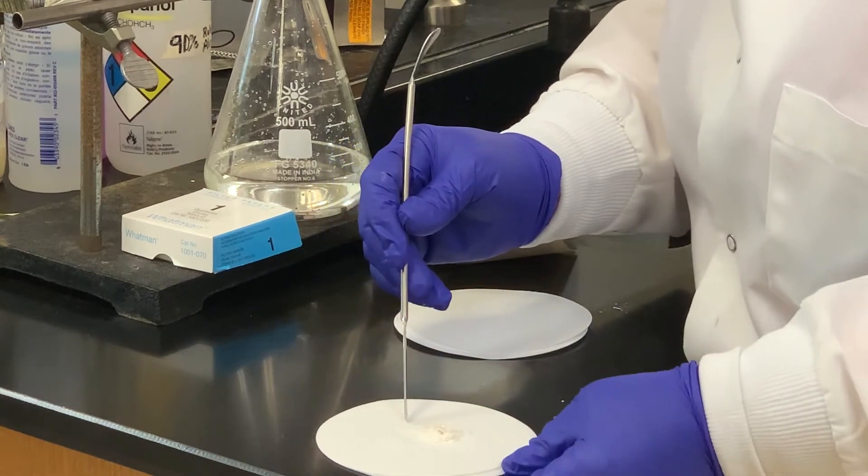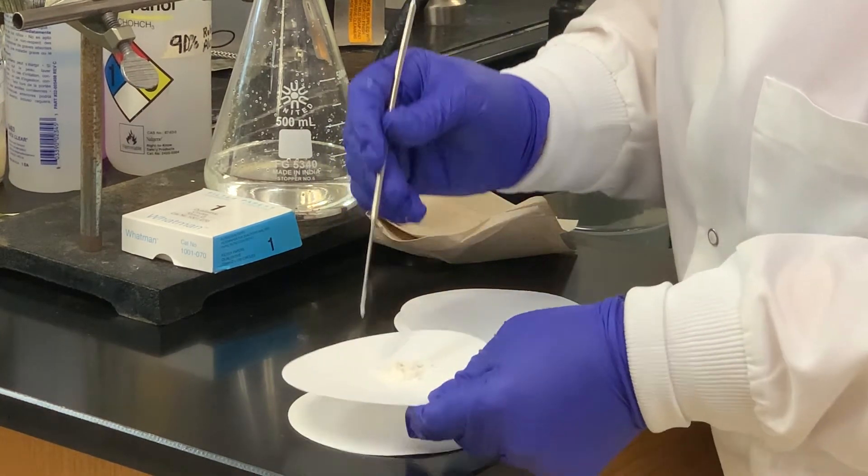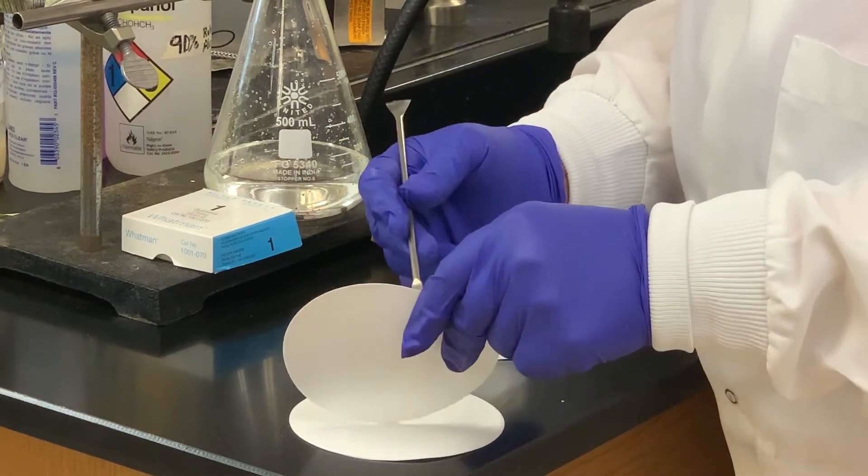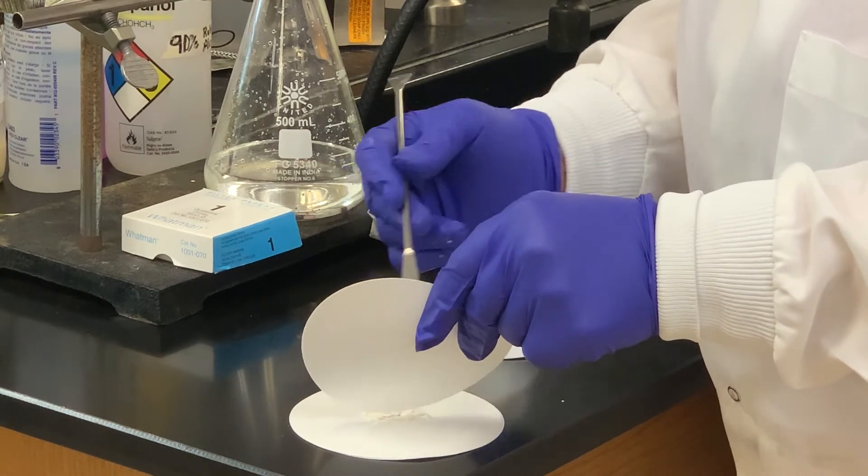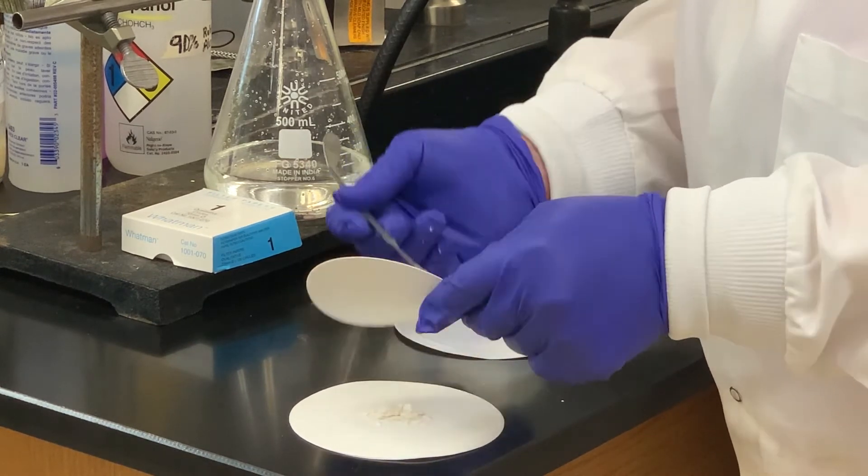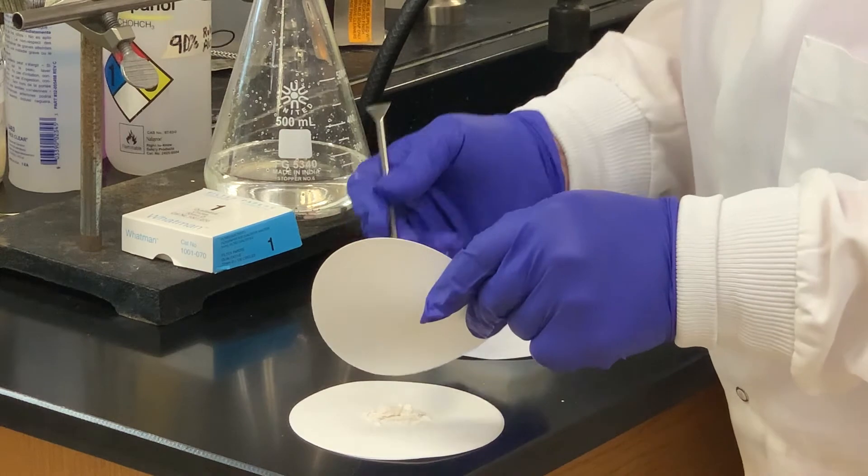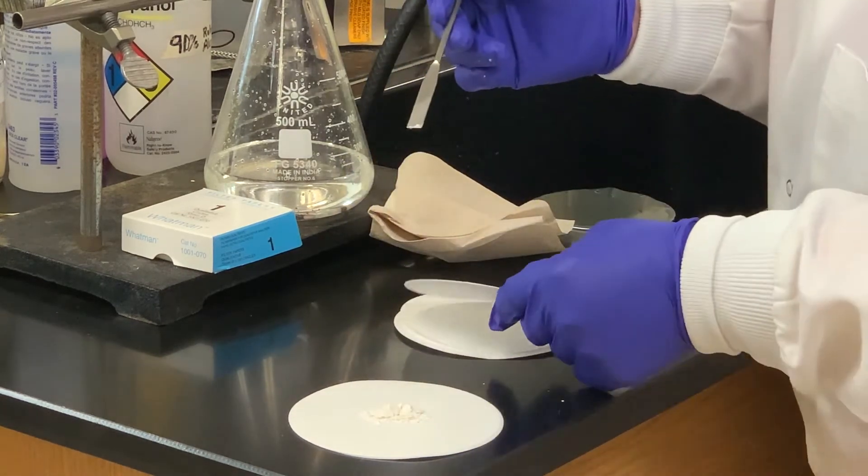Okay, I'm going to try that one more time. Especially since we used water as a solvent here.